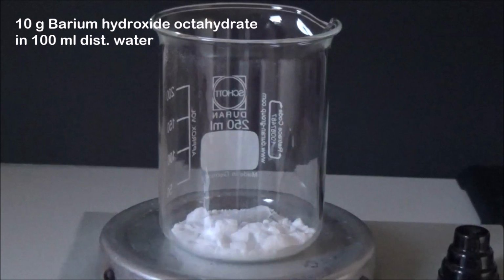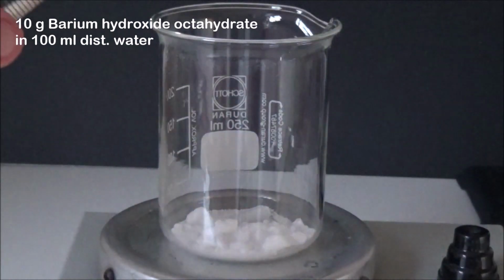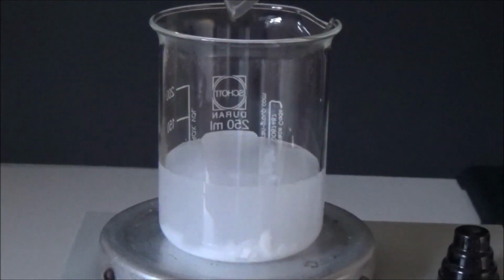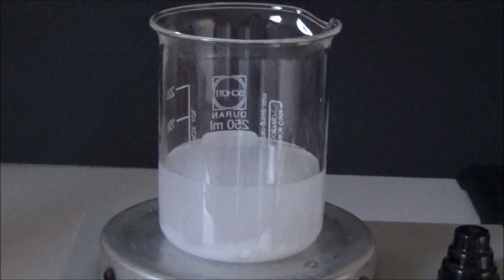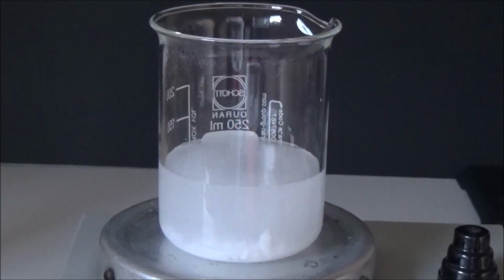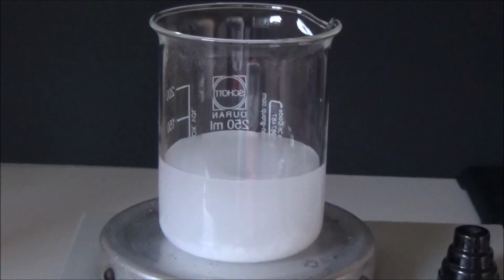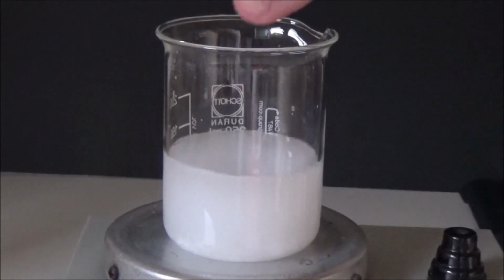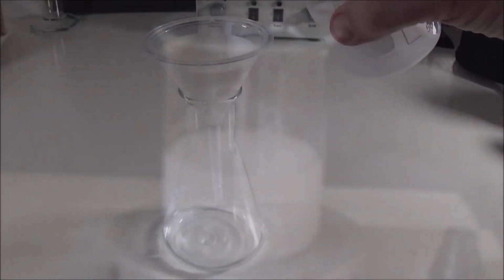To begin with, we dissolve 10 grams of barium hydroxide octahydrate in 100 ml of distilled water with magnetic stirring. This corresponds to an excess of 2.8 grams but is necessary to achieve a cold saturated solution, since the solubility is very temperature dependent and the substance inevitably contains a certain proportion of insoluble carbonate. In order to keep the formation of even more carbonate as low as possible, the beaker is covered with a watch glass during the dissolving process, which is intended to reduce the possible entry of carbon dioxide. Of course, it also keeps back corrosive splashes.